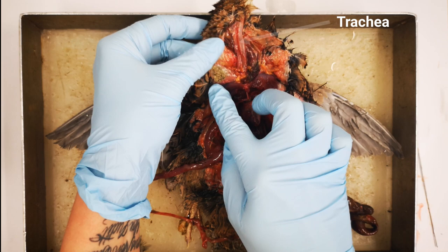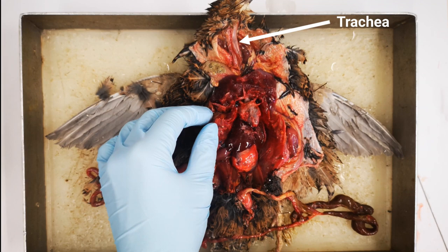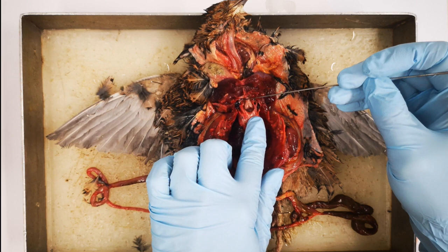The trachea is often very long and, in addition to the actual larynx, there is a uniquely avian vocal organ, the syrinx, which lies at the transition point between the trachea and the two bronchi. Unlike mammals, birds do not produce sounds with the larynx, but with the syrinx.